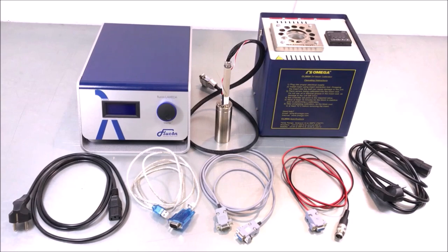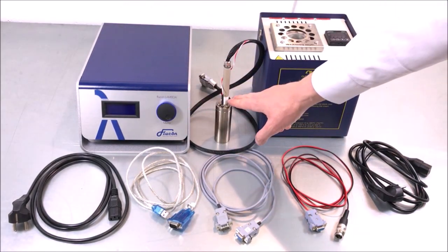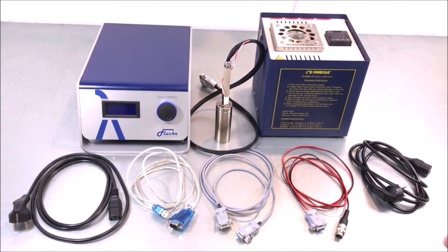The following components are included in the scope of delivery of your thermal conductivity meter Lambda. First of all, you will have the electronic box as well as the sensor with the screw-on sample cup.